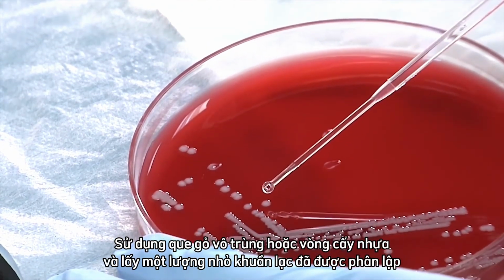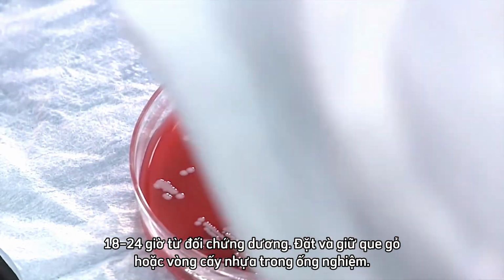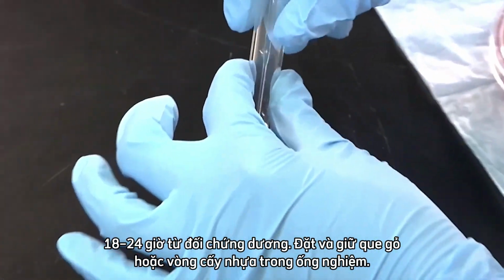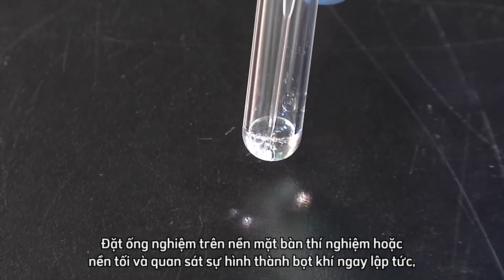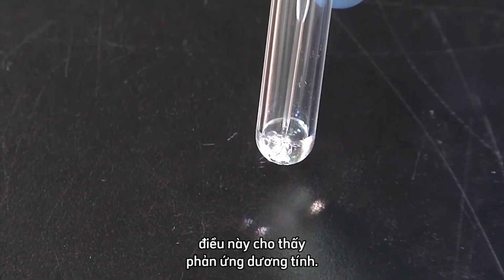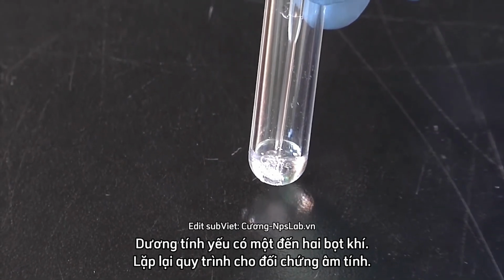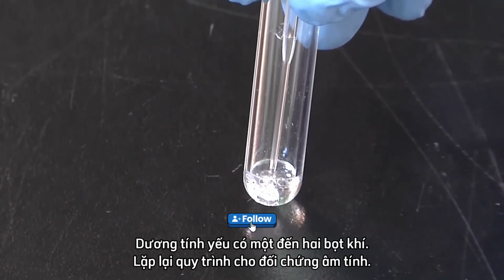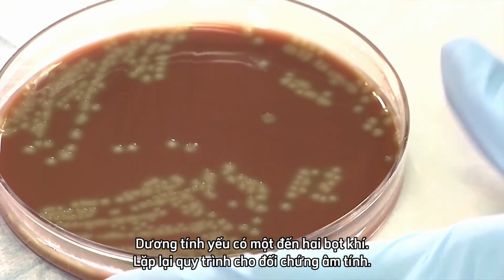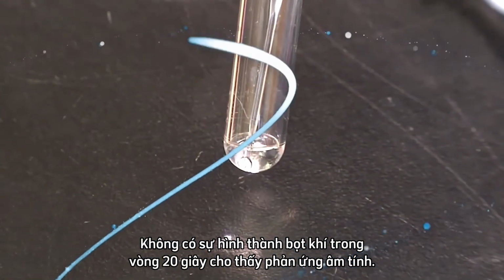Use the sterile applicator stick or plastic loop and pick up a small amount of an 18 to 24-hour-old isolated colony from the positive control. Place and leave the applicator stick or plastic loop in the tube. Place the tube against the bench top or a dark background and look for the immediate formation of bubbles, which indicates a positive reaction. A weak positive has 1 to 2 bubbles. Repeat the process for the negative control. No formation of bubbles within 20 seconds indicates a negative reaction.